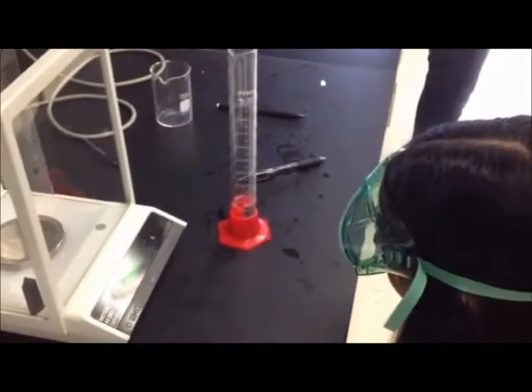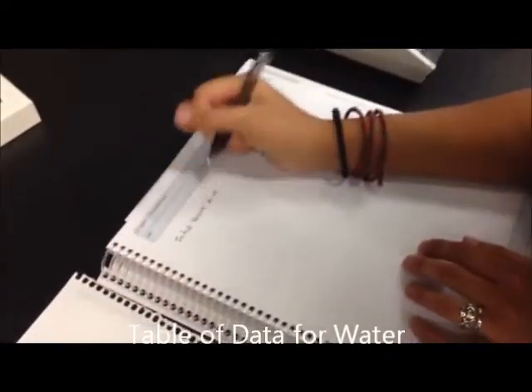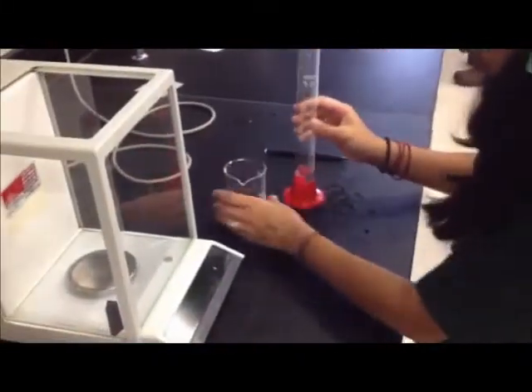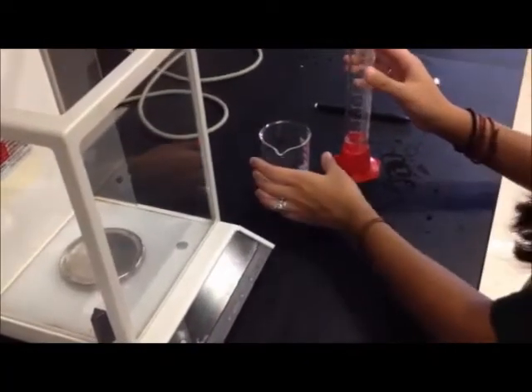The first thing she's doing is recording the volume of her solution. She first tares the scale to ensure that there's no miscalculations. Then she'll place the beaker onto the scale to get the weight of the beaker.